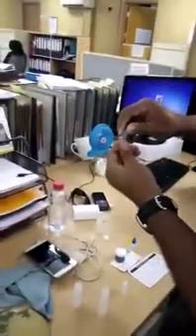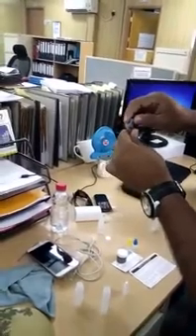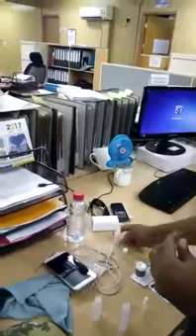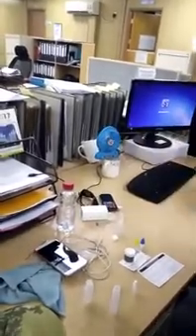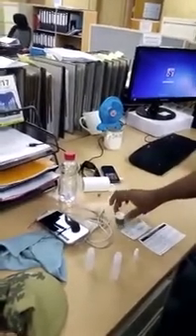This is our rinsing bottle — this glass reagent. Drop it here, then keep this one with just small shaking. Wait two minutes.